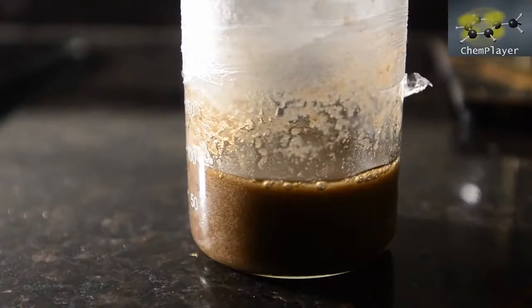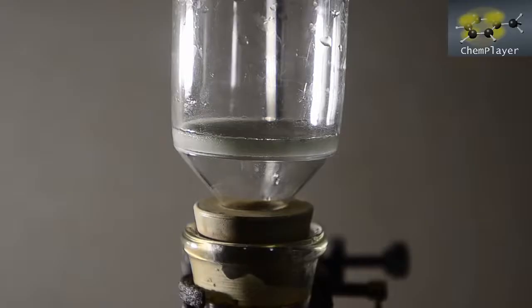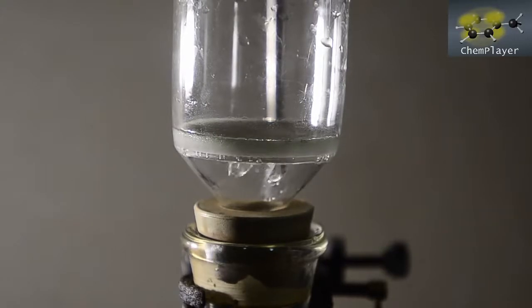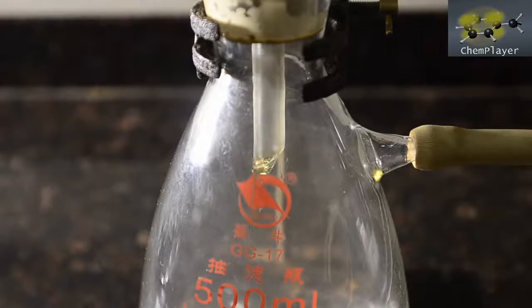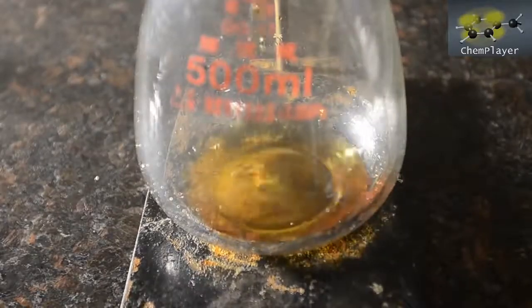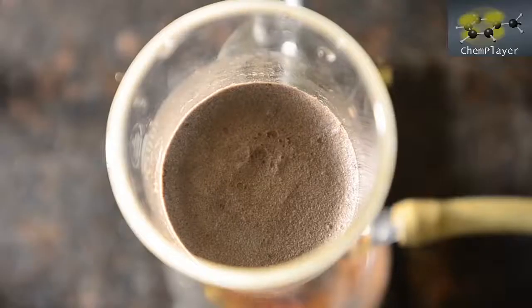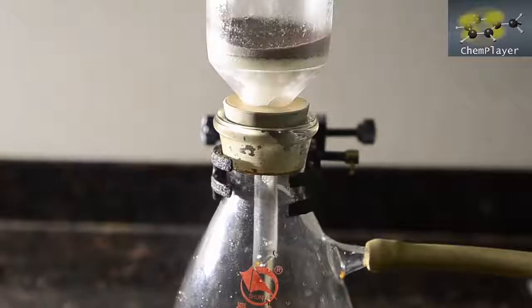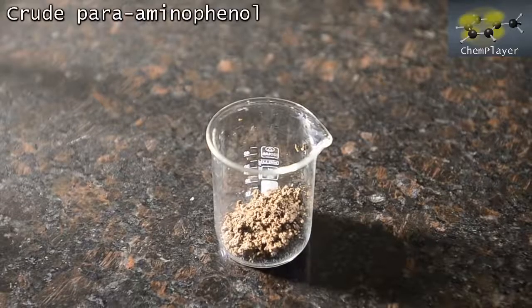And here we are with chilling right down to about 5 degrees. See lots of crystals in suspension in the mixture. So let's filter. And we get these as dry as we can. Okay, here's our crude product.